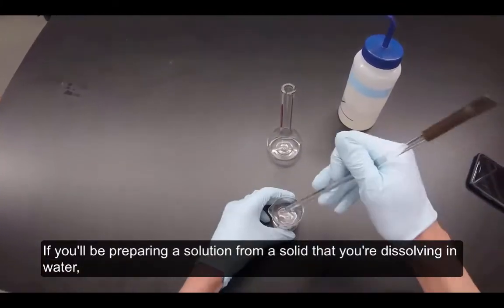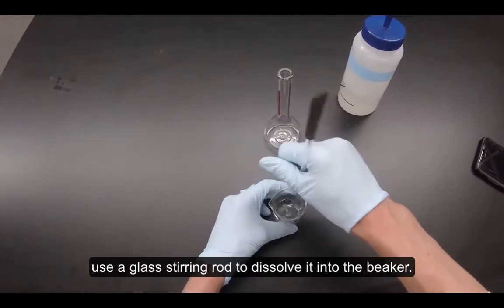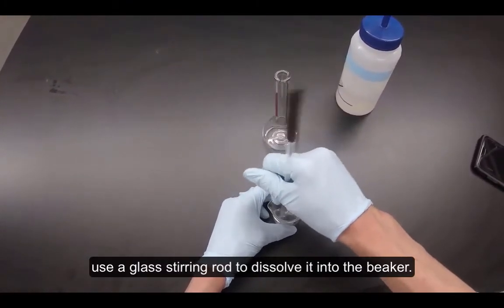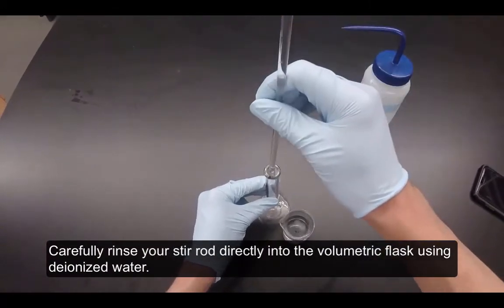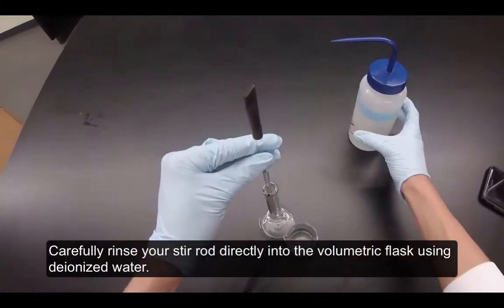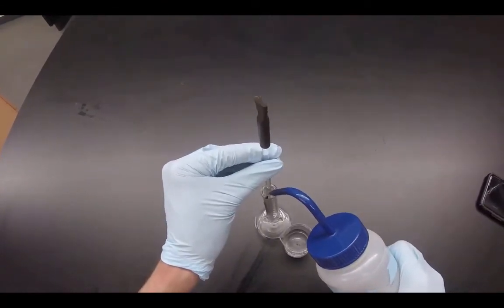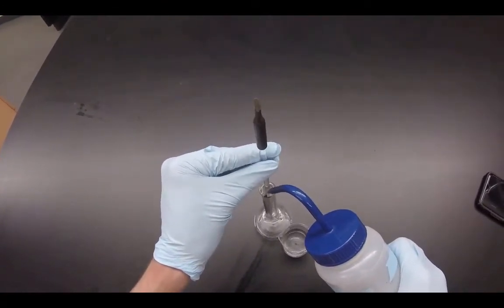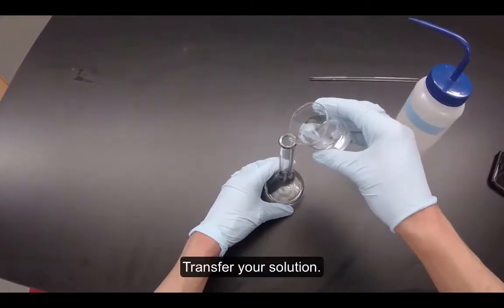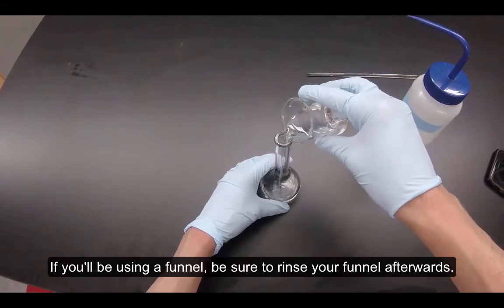If you'll be preparing a solution from a solid that you're dissolving in water, use a glass stirring rod to dissolve it into the beaker. Carefully rinse your stir rod directly into the volumetric flask using deionized water. Transfer your solution, and if you'll be using a funnel, be sure to rinse your funnel afterwards.